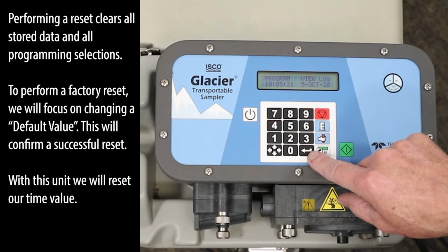Performing a reset clears all stored data and all programming selections. To perform a factory reset, we will focus on changing a default value. This will confirm a successful reset. With this unit, we will reset our time value.